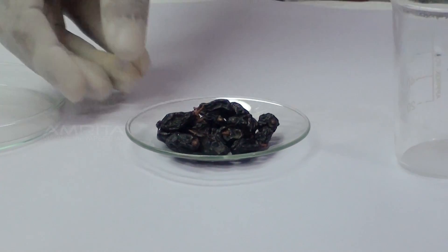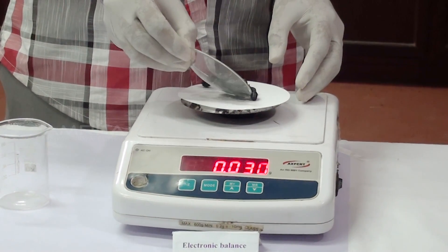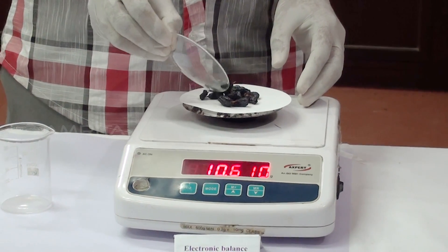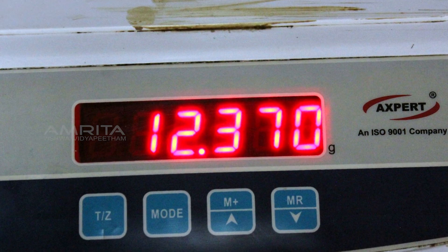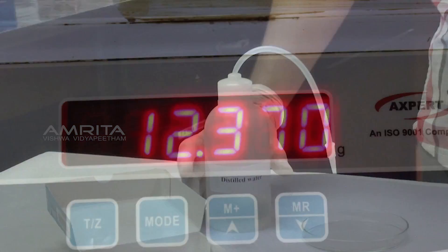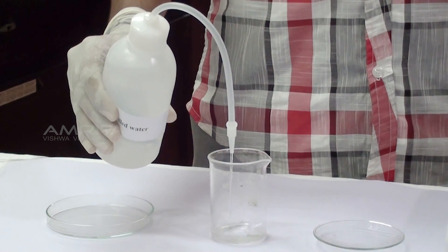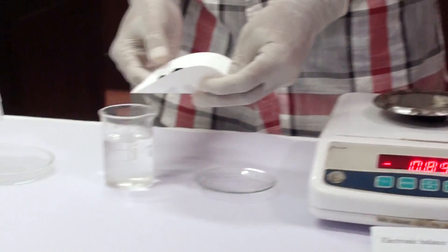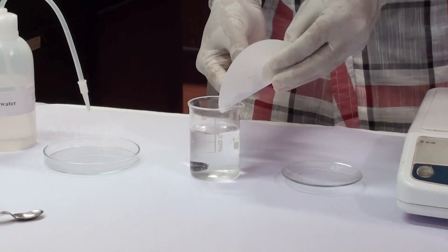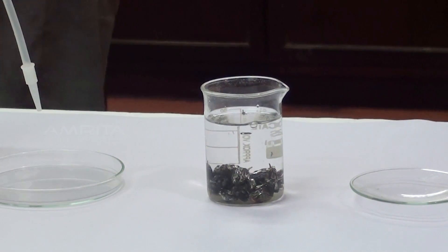Procedure: Take about 20 dry raisins. Weigh the raisins using an electronic balance and note the weight. In this case, the weight of the dry raisins is 12.370 g. Take the bottle containing distilled water and pour some distilled water into the beaker. Take the weighed raisins from the balance and put them into the beaker. Allow the raisins to soak for 2-3 hours.